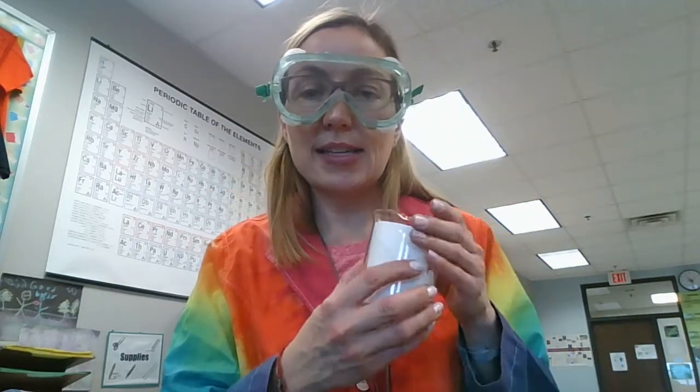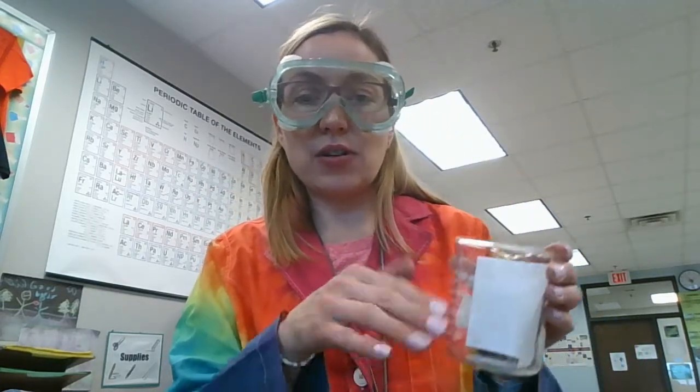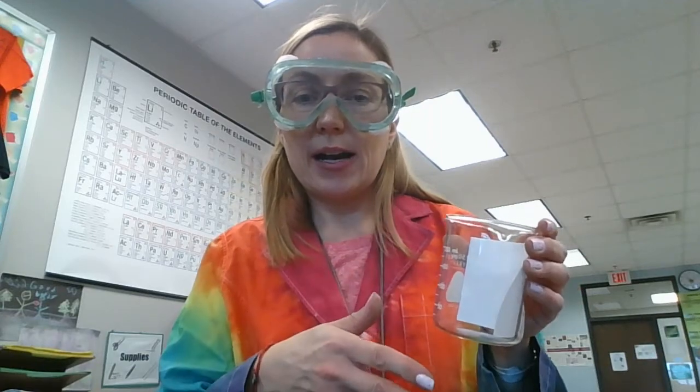When you put a little bit of solvent in there, you're going to cover your beaker with a watch glass, and that solvent is going to go up the filter paper and evaporate and fill the chamber with more solvent vapors. That helps the plate run faster and more evenly when the whole chamber is filled with solvent vapors.